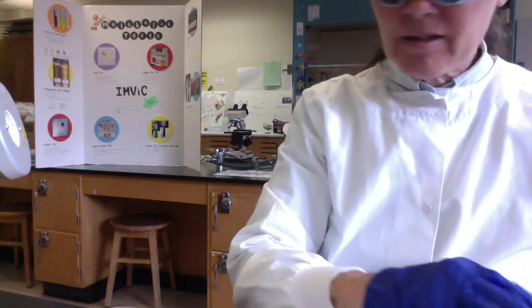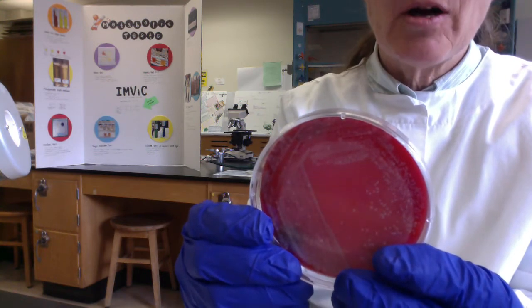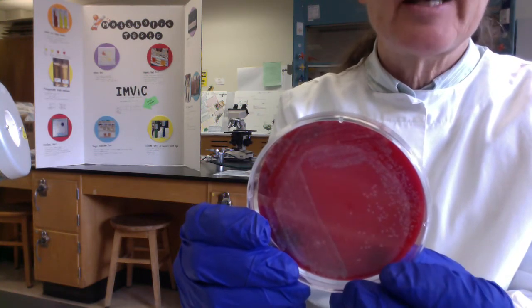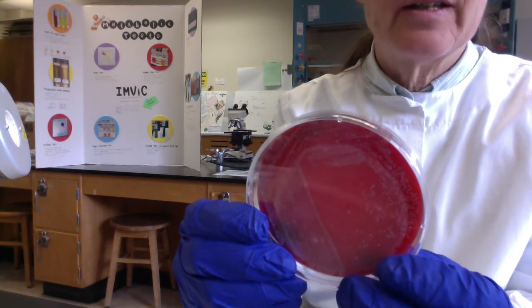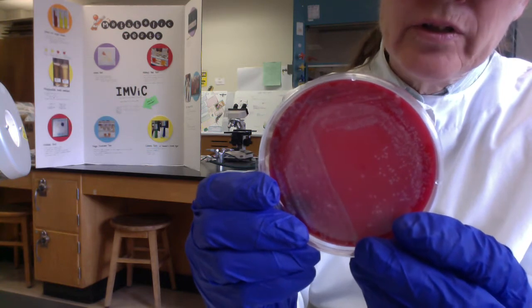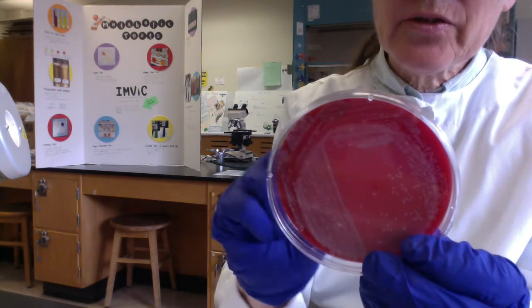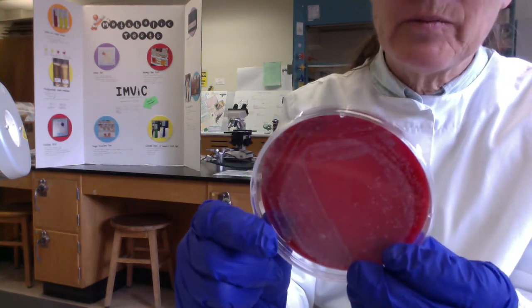Okay, and then this last one, folks, was of my nose. And I know historically, off and on, when I take samples from my nose, I will see sometimes I'm carrying Staphylococcus aureus, the beta hemolytic bacterium. And although it's hard to see here, folks, if I hold this plate up to the light, there's some colonies that look like they might be just starting to carry out beta hemolysis.